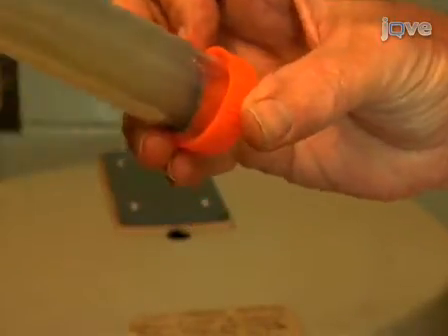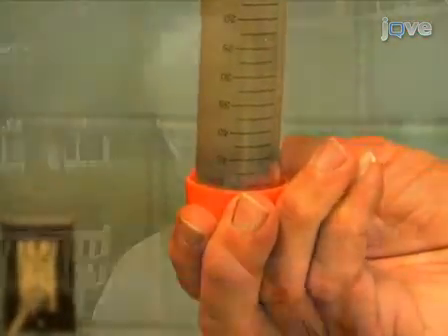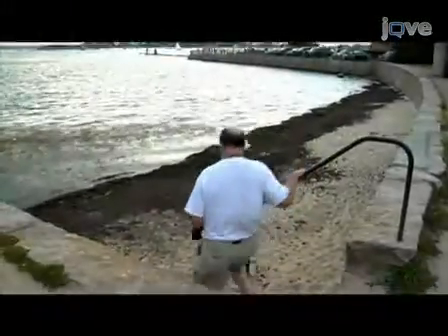So today, we have shown you how to collect blood from the American horseshoe crab. The major enemy of the procedure is the premature clotting of the blood before we are able to separate cells from plasma. If you follow the steps outlined in today's procedure, this minimizes the likelihood that clotting will occur. Remember, some animals have particularly excitable blood cells, and even when following these procedures to the letter, blood clotting can still occur before cells can be centrifuged free from the plasma. This procedure has a happy ending — we can release this hardy creature back into the wild after collecting as much as 200 milliliters of blood. It will survive and carry out the rest of its life.